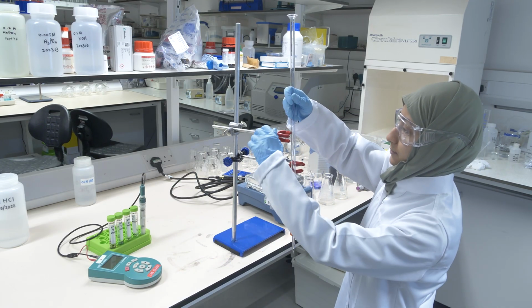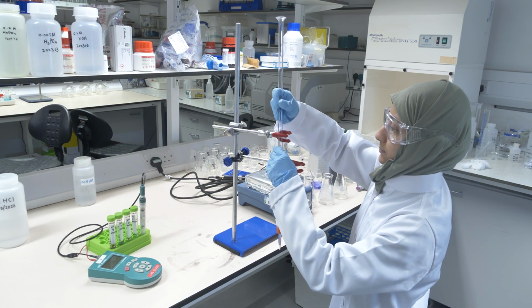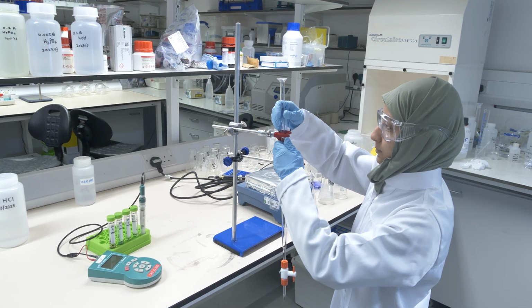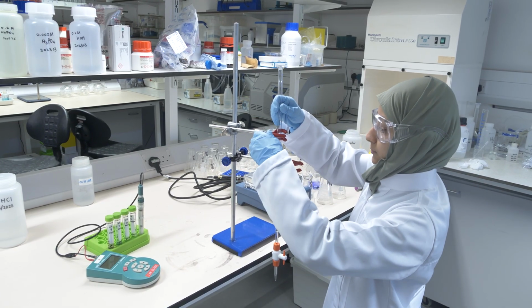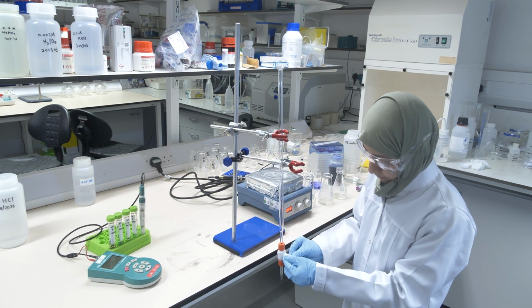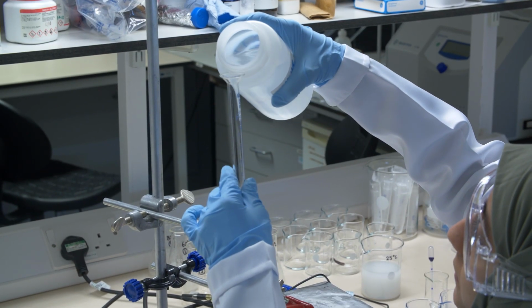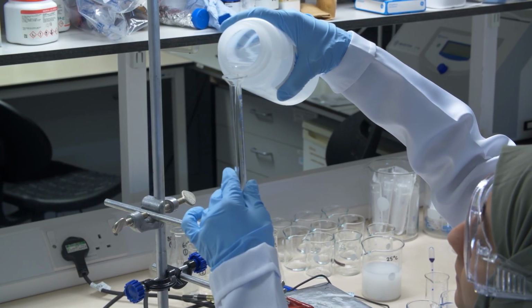So we use a burette this time to add the acid. Remembering the video which you saw on the acid base, there we added the acids and the bases with a pipette. In this experiment we use a burette. The burette gets prepared, so you see here, it closes the valve below. That's very important, the valve is closed, and then Fatimah carefully adds the acid.